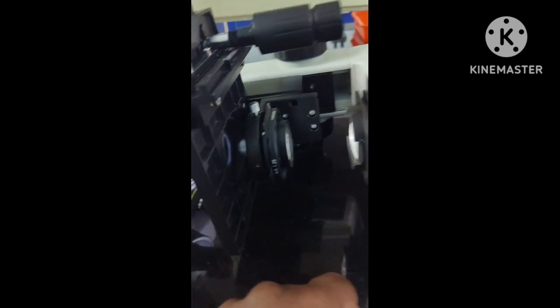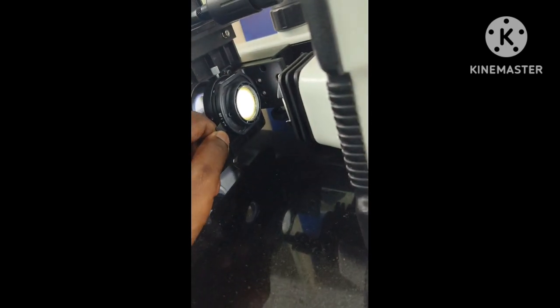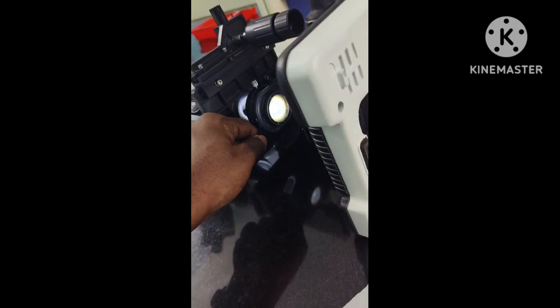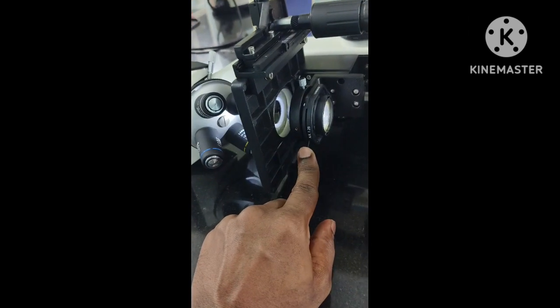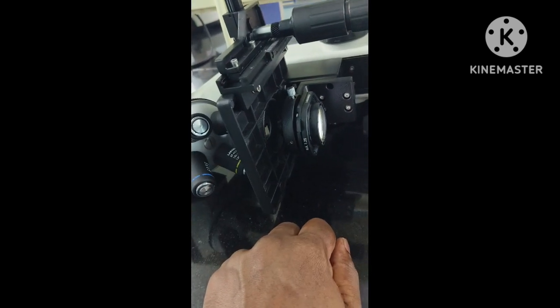And then what is the diaphragm? If you see here inside, you see an area, this glass. If you watch closely, when I move this lever, which closes and opens the diaphragm, you can appreciate how the diaphragm is moving. Now I am opening the diaphragm and you can appreciate a small hole is formed in that area. Now I am closing it, opening it, closing it. From this side, you can see how light is allowed to get into your eyes when it is open. When it's closed, the light is not passing to your eyes.